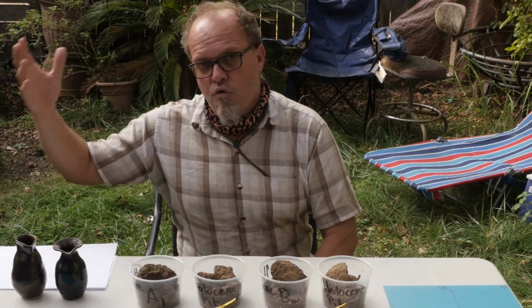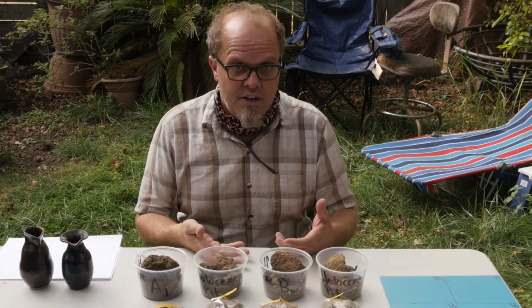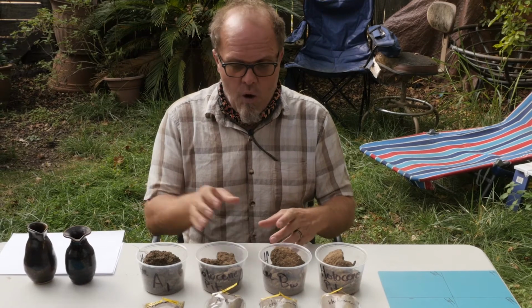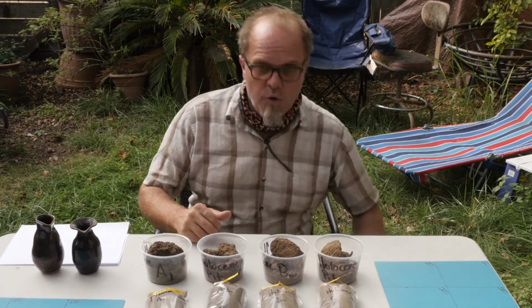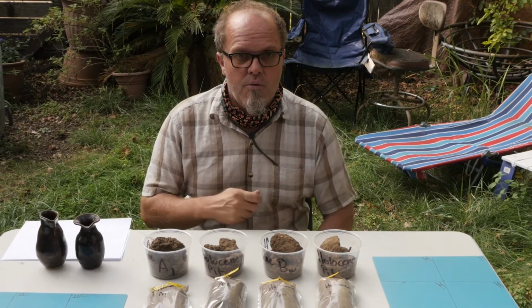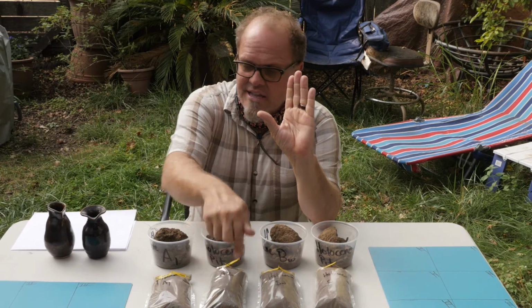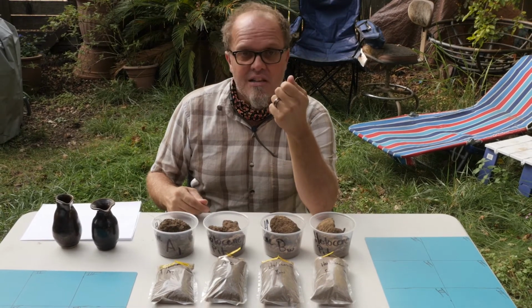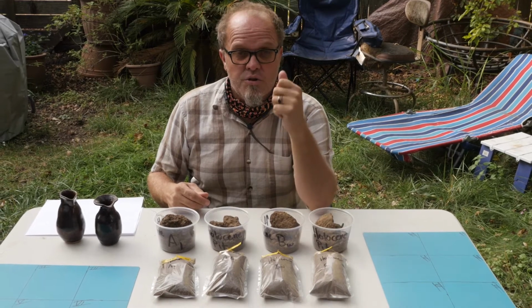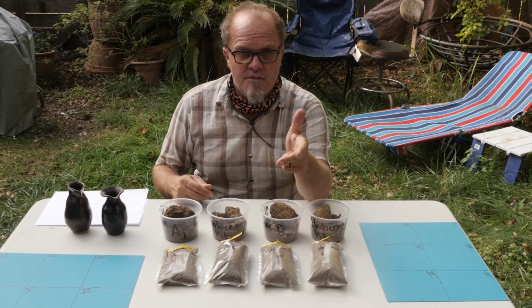We could talk about rocks and larger aggregates that we would collect in the field. We showed you in the video just a little bit ago how there were gravels and cobbles in some of these samples. Now we're going to work through and get to the point where we can show you that by just using your hand, this sample, and a little bit of water, you can get a pretty good estimate of the soil texture, which remember is the percentage of sand, the percentage of silt, and the percentage of clay.